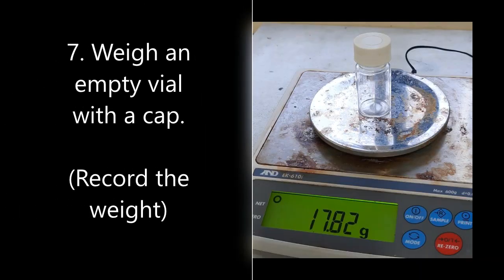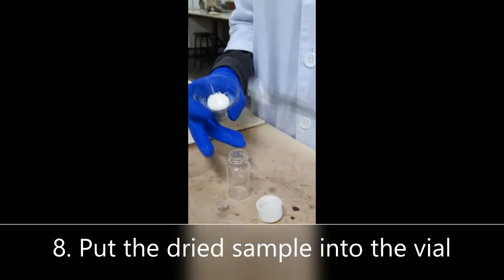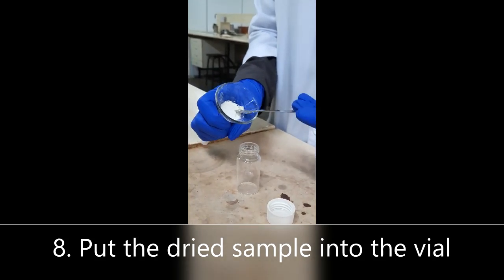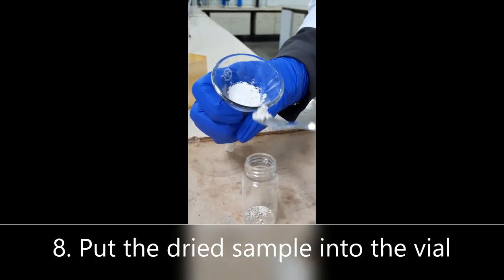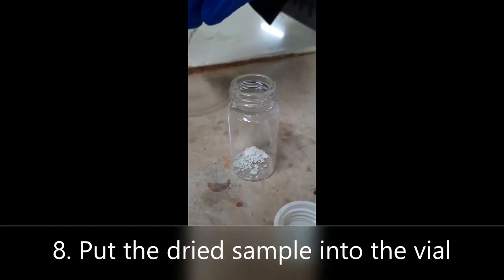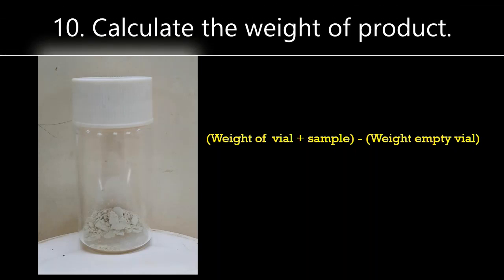Weigh an empty vial with the cap attached and record the weight. Carefully transfer the solid into the weighed vial. Calculate the product weight using this equation.